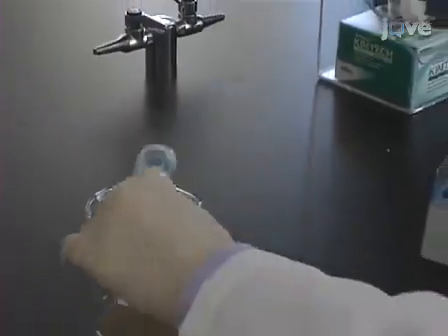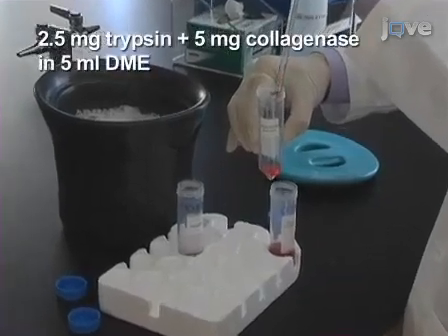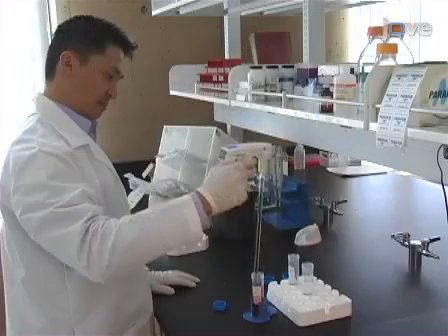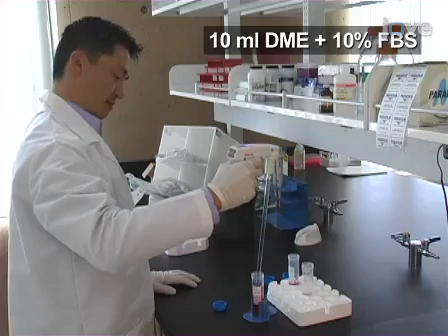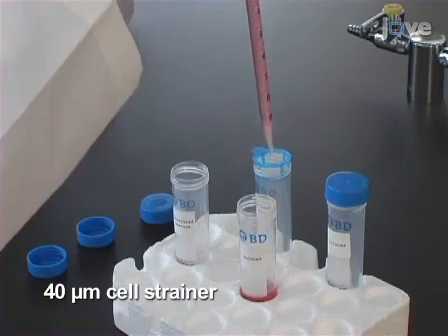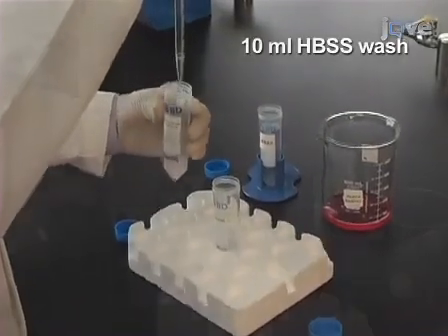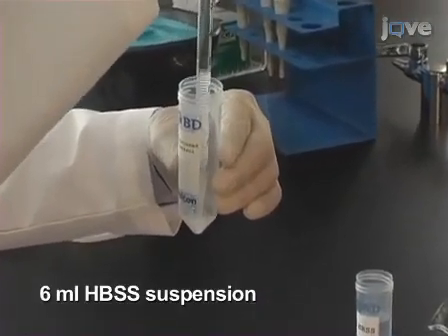Then further dissociate the spinal tissue with a trypsin and collagenase solution in 5 milliliters of Dulbecco's modified Eagle's media, or DME, for 20 minutes at 37 degrees Celsius before trituration with a glass Pasteur pipette. Next, add 10 milliliters of DME plus 10% fetal bovine serum to cells to inhibit enzymatic activities, and then filter the cell solution through a 40 micrometer cell strainer into a 50 milliliter tube. Spin the cells for 3 minutes at 4000 rpm at room temperature. Then wash the pellet. Next, resuspend the cell pellet in 6 milliliters of HBSS for overlay on OptiPrep gradient solutions.